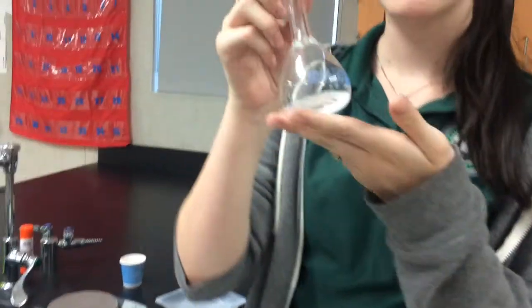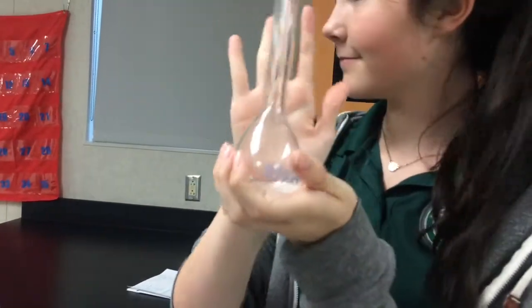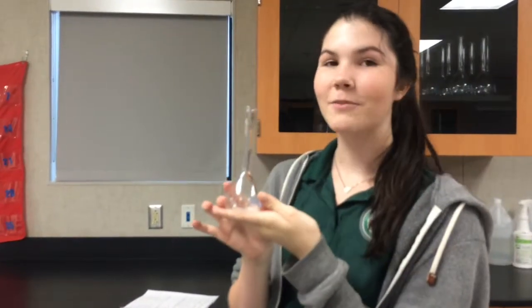Then I put that in a volumetric flask, which is this one. Then we're going to add enough water to make it a hundred milliliters.